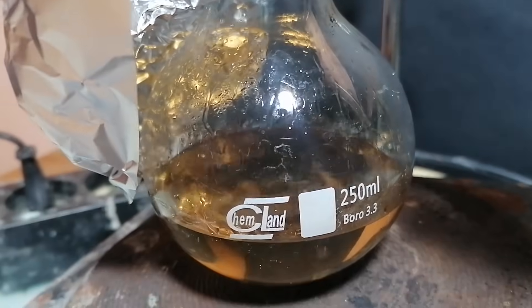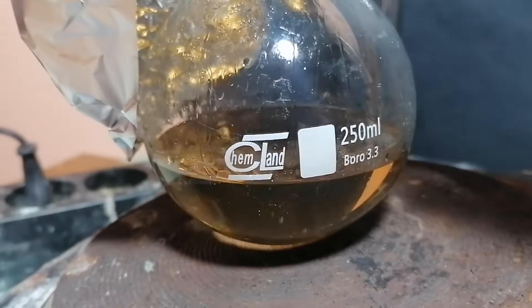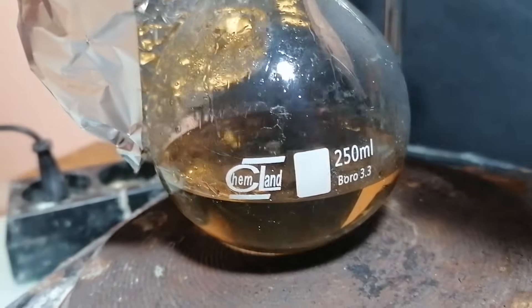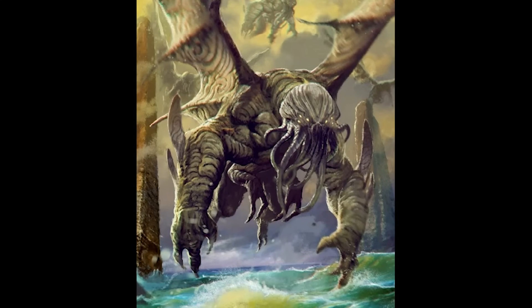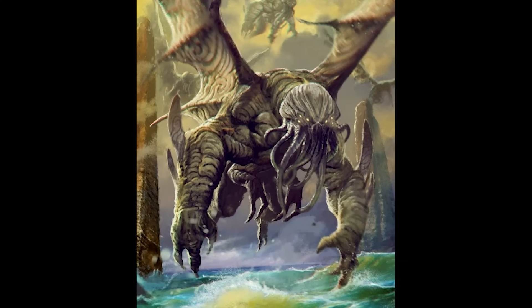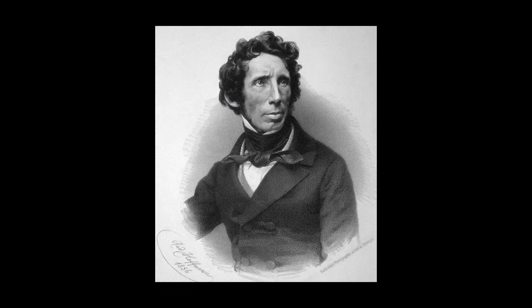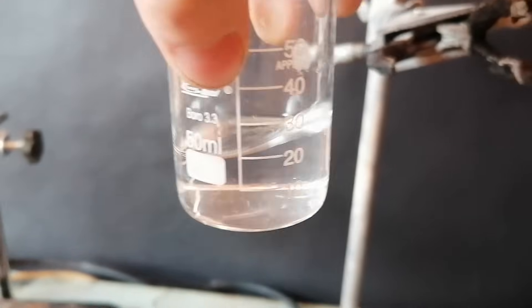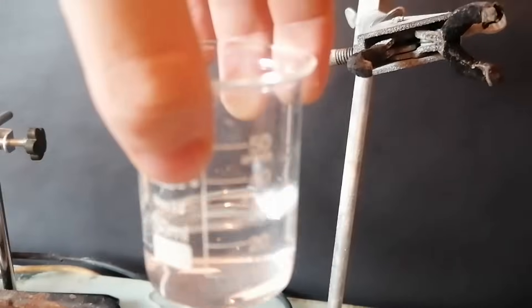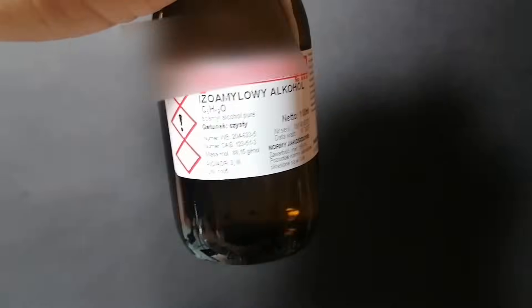Here's me smelling the distillate. It was concentrated. Eventually, for whatever reason, the whole thing turned brown, and that's just organic chemistry — it tends to do random stuff with no explanation. This is around 20ml of our glacial acetic acid, and it's just enough for the reaction. This is some isoamyl alcohol that I've ordered, and now it's ready to be bananified.